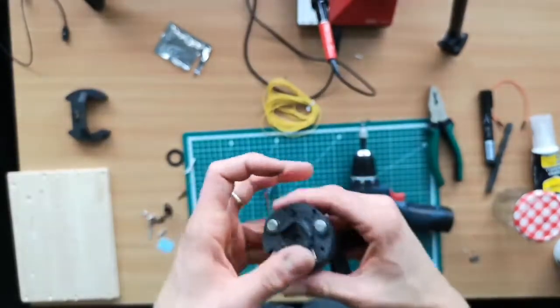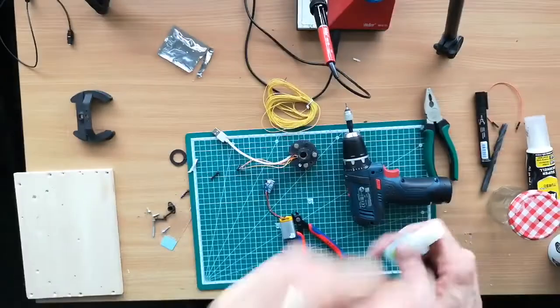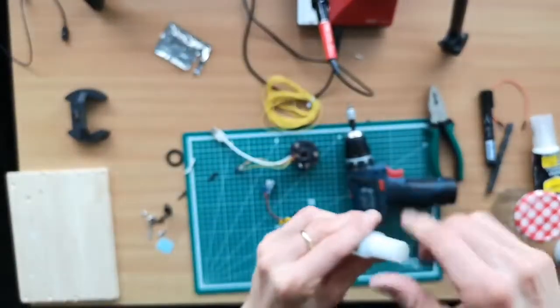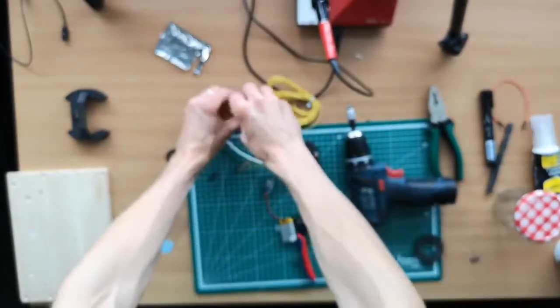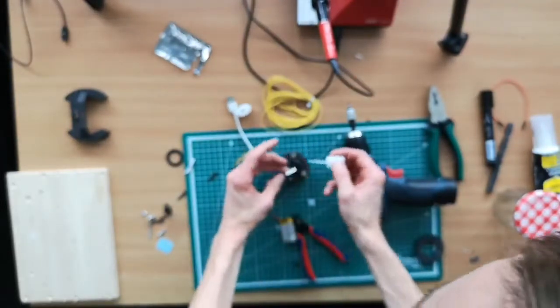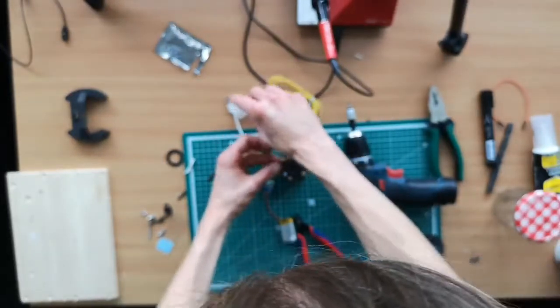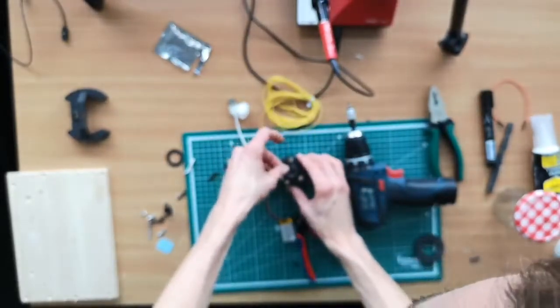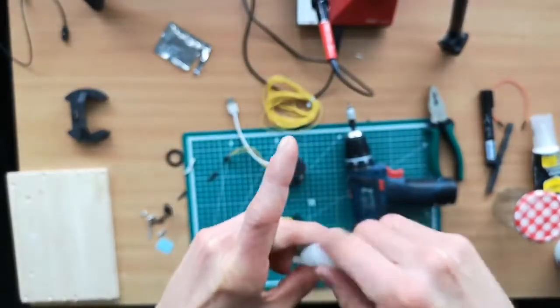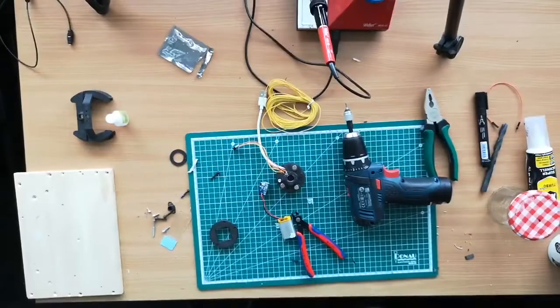And maybe we also use some glue to fix the lens here. So we use some glue to mount the lens inside the casing, otherwise it will always get off. Some tiny mounts on the metal part, and then we wait for a moment. It's just some random glue we just found. Okay, so we can continue now.